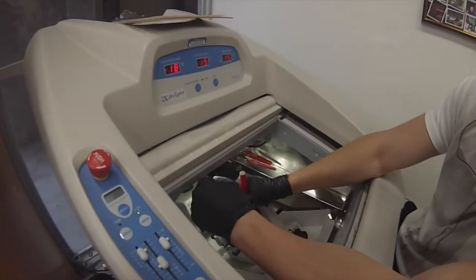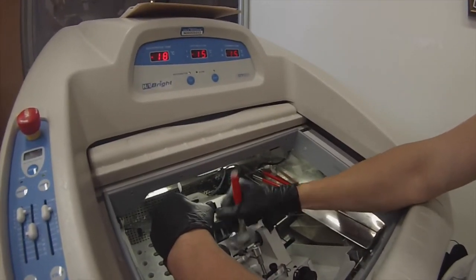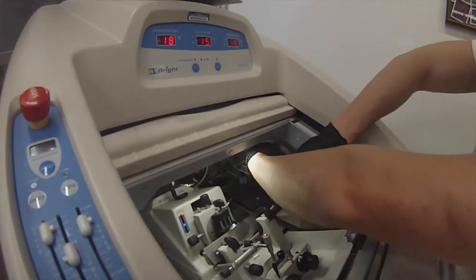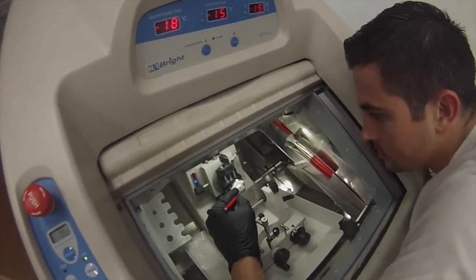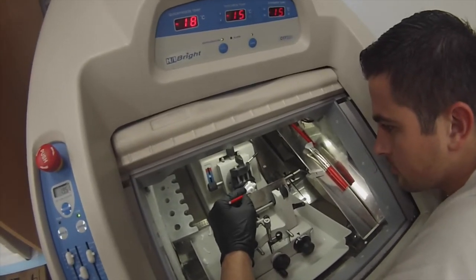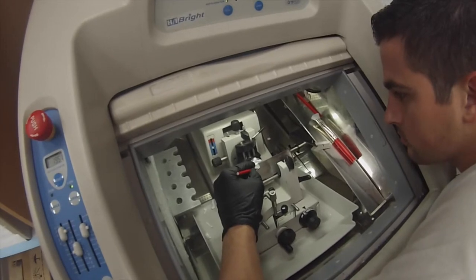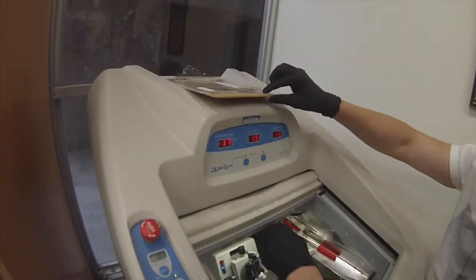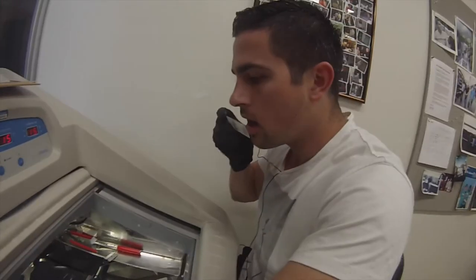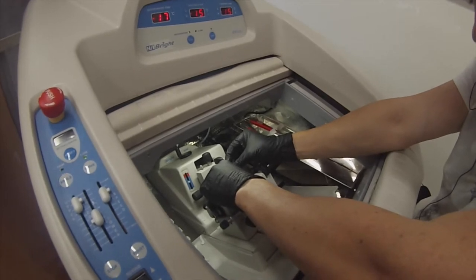That's pretty much the process of how you're going to get a section onto a slide. Doing it one more time — slowly guiding it, making sure to heat up the blade with my breath. You also want to make sure you brush the blade between each cut so it stays as sharp as possible, with no nicks or folds when sectioning the sample, which is usually frozen in OCT.